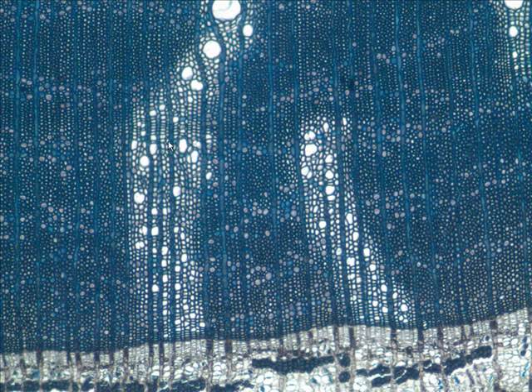First of all, is this the oldest secondary xylem ring or the youngest? Well, it's right up against the vascular cambium, so it must be the youngest. But we see several different types of cells in cross-section, and I want you to be able to identify three different types of secondary xylem cells.